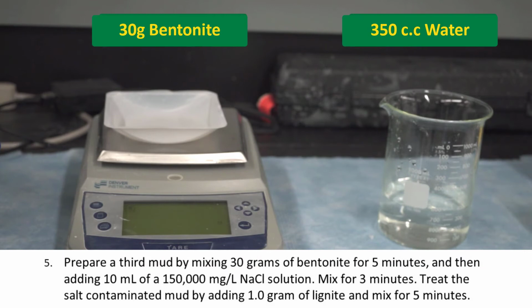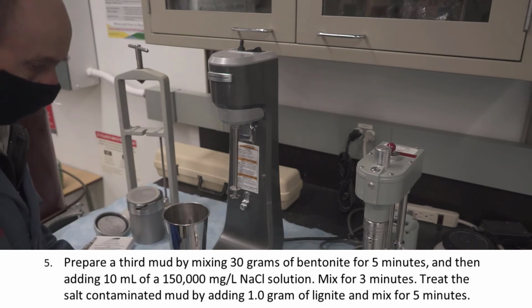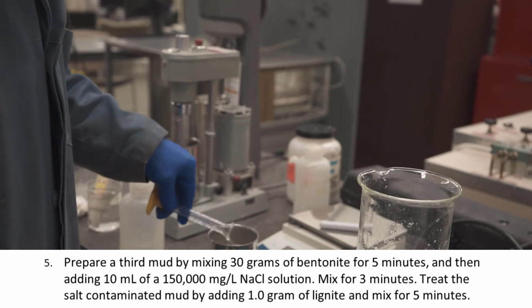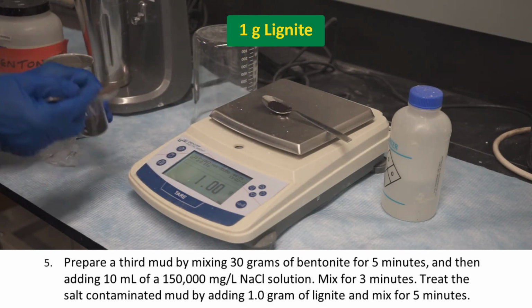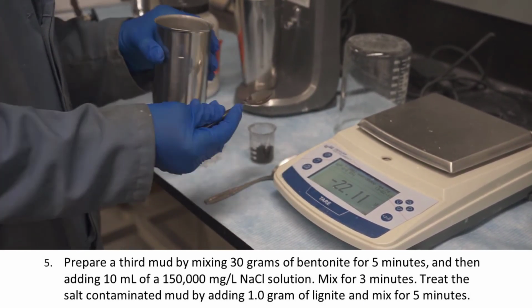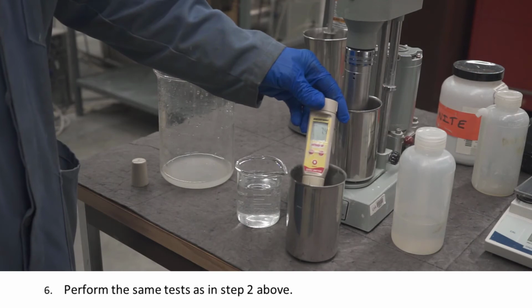Prepare another salt-contaminated mud sample by mixing 30 grams of bentonite and 350 cc's of water for 5 minutes before adding 10 milliliters of the 150,000 milligram per liter sodium chloride solution and mixing for another 3 minutes, just like you did in step 3. Then, treat this salt-contaminated mud sample by adding 1 gram of lignite and mixing for 5 minutes. Perform the tests from step 2 on this treated mud sample.